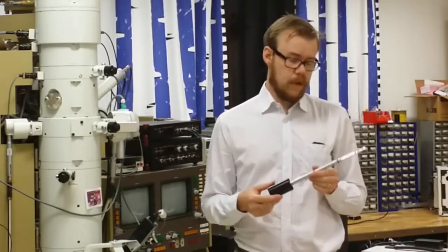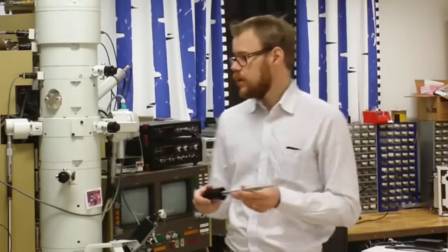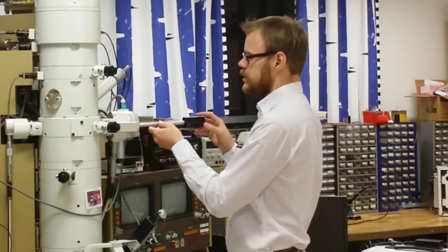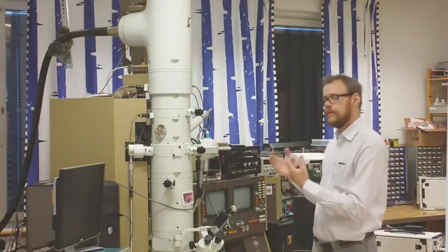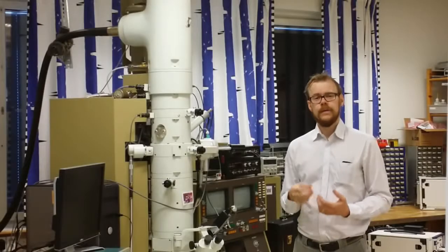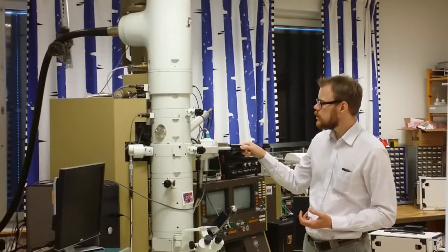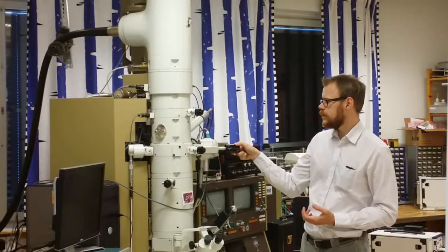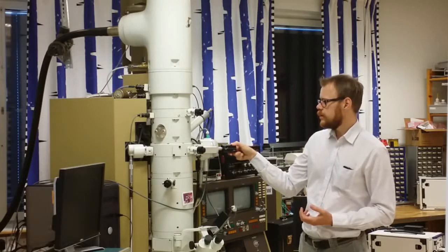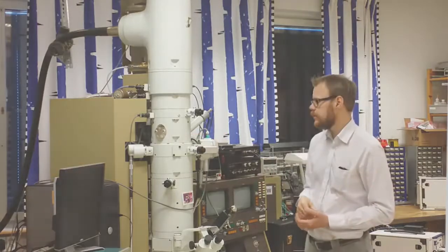So here I have the sample holder. The samples have already been mounted at the top here. We insert this sample holder in the side here at the midsection of the column. The vacuum will start to pump, and this usually takes a few minutes. So now when the air has been evacuated in this pre-chamber, we can rotate the sample and gently insert it inside the microscope. Be careful though that you continually hold and grab the holder while you insert it. Otherwise it might go too fast inside and actually hit something and destroy that.